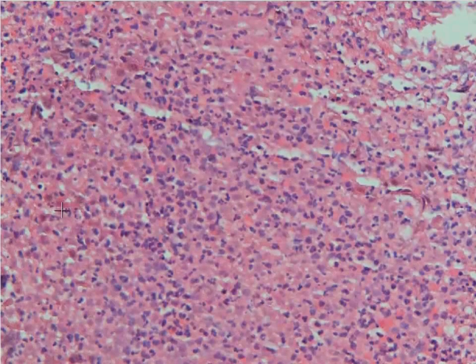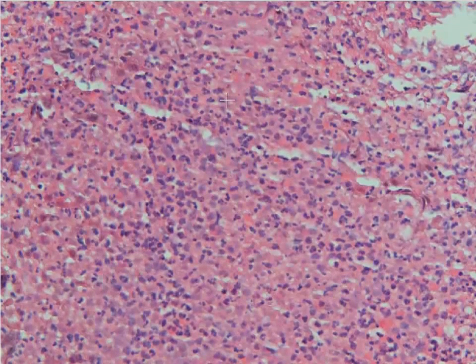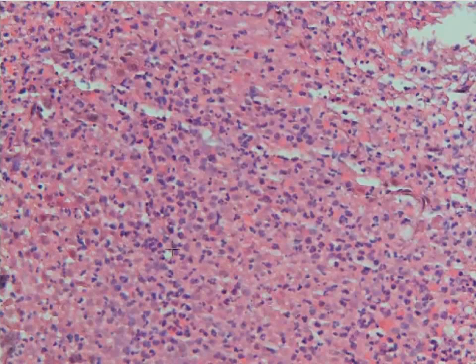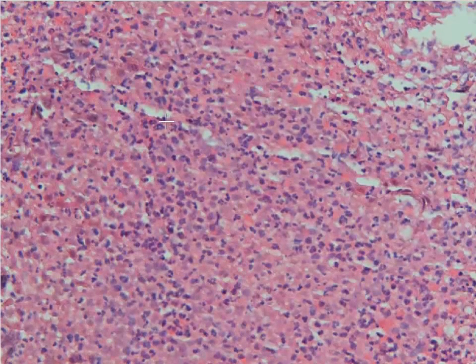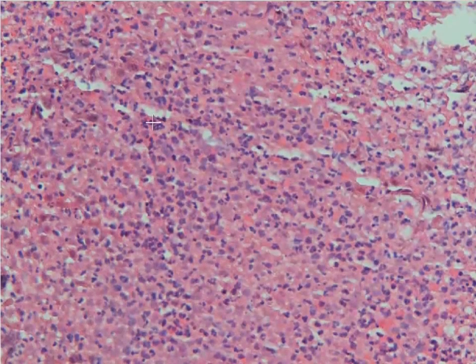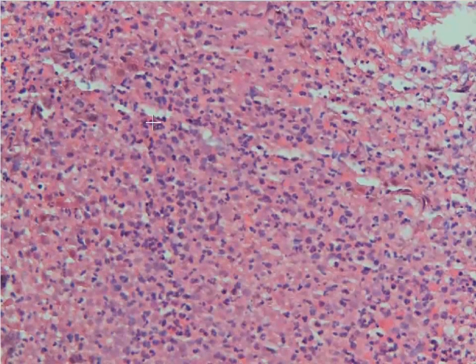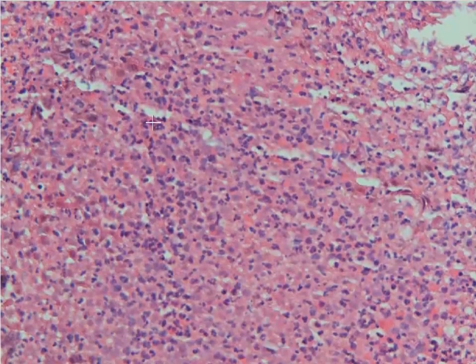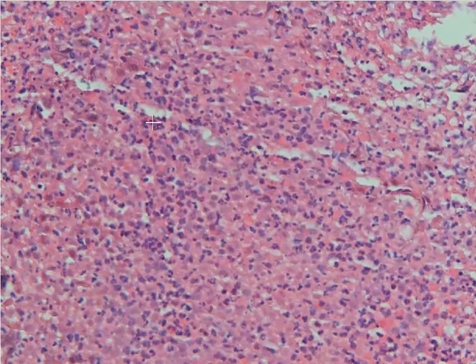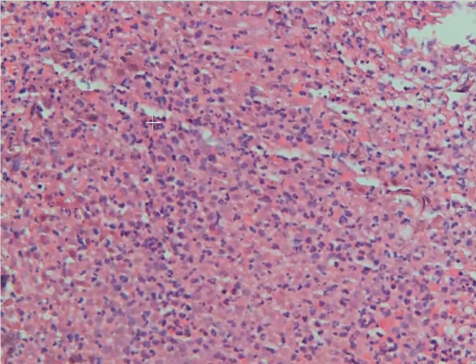Coagulative necrosis means that you can still see the outline of the cell, but you can't see the nucleus anymore. In addition, you have pockets of neutrophils — you can tell because they have multi-lobated nuclei and pink cytoplasm. The background they're all set in is blood and fibrin, as part of the inflammatory exudate that's present.